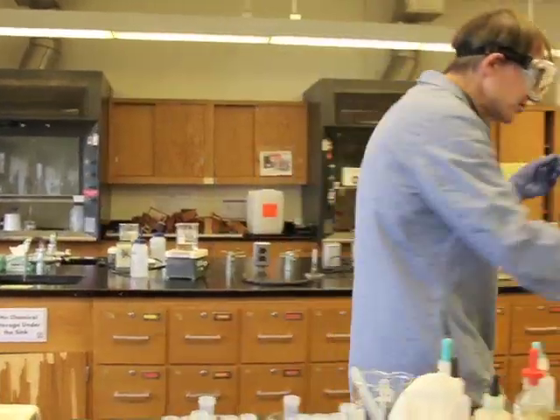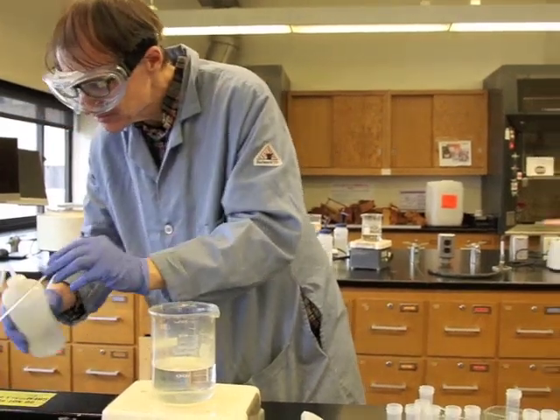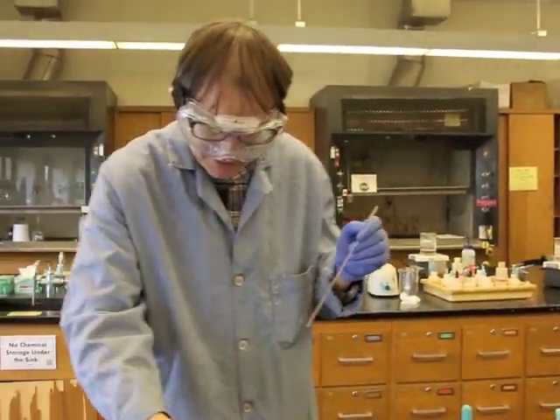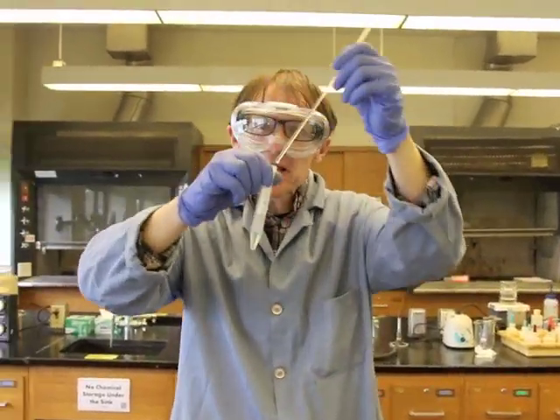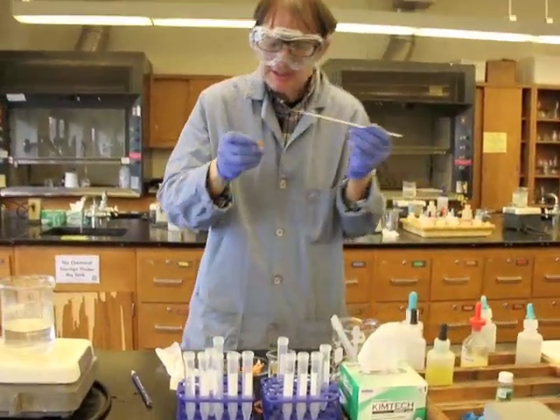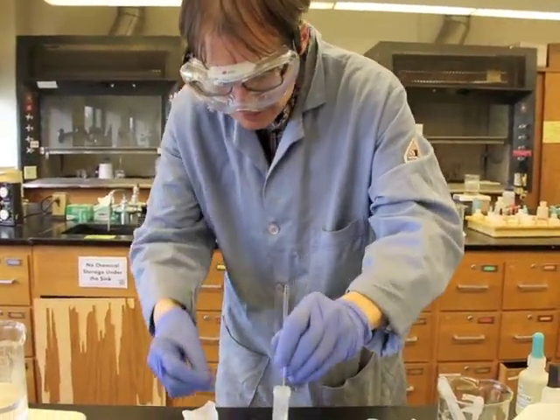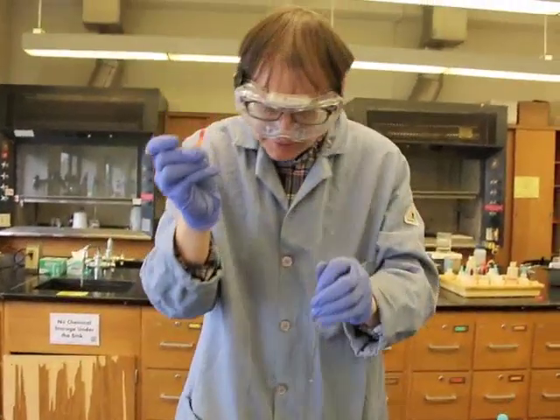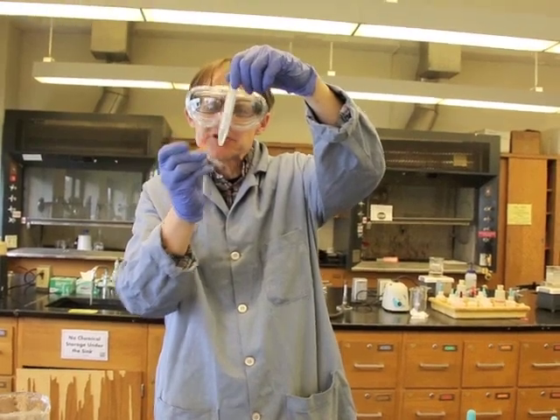Okay, so now, let me just be a little bit careful here and make sure that we've got a clean stirring rod. So I'll rinse this a little bit with some distilled water. Wipe her clean. And let's take a look here. Mixing it in there. Now, I added hydrochloric acid. We're going to test to see whether it's really acidic. Is that solution acidic? Well, let me try another drop. There we go. Red. pH paper turned red. That tells us this is definitely acidic. That means we added enough hydrochloric acid.